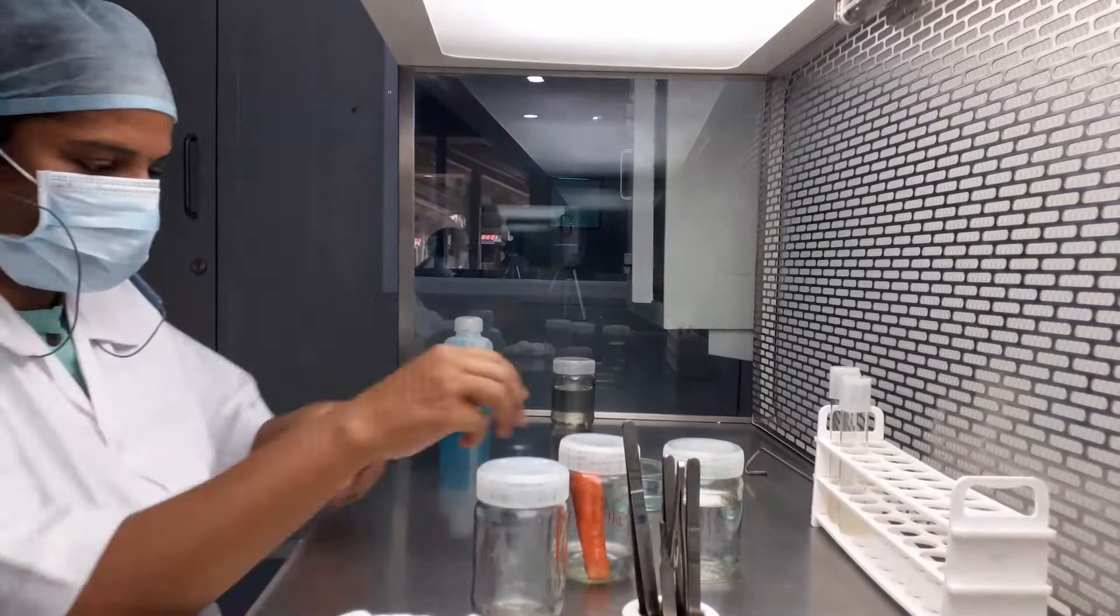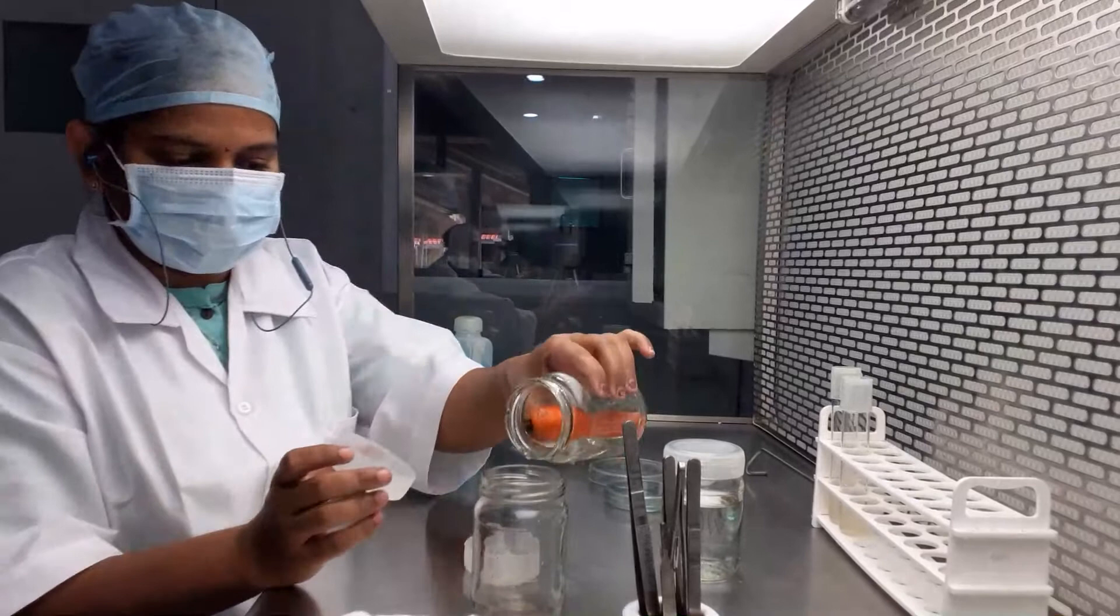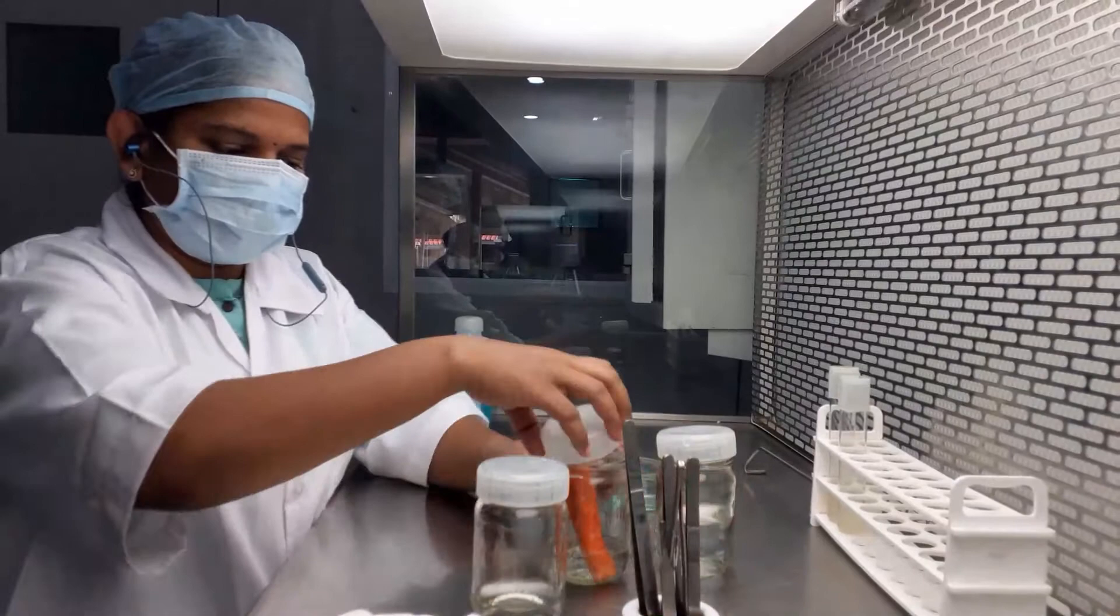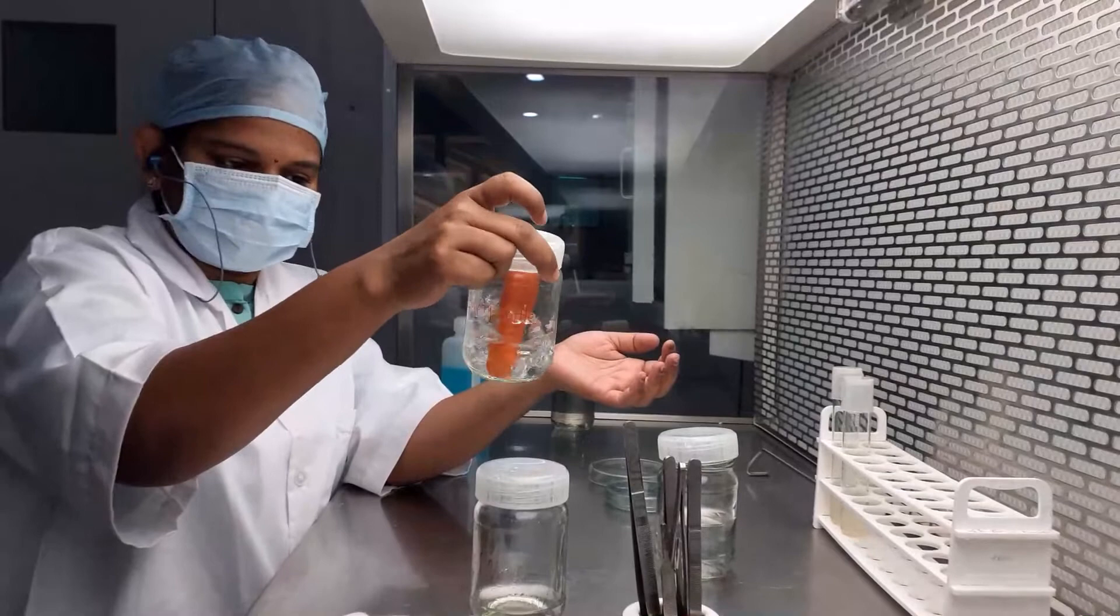We have done with the 10 minutes of HgCl2 wash. We will decant the HgCl2 solution and rinse the explant with double distilled water in order to remove the traces of HgCl2 from the explant. Gentle rinsing will be done.